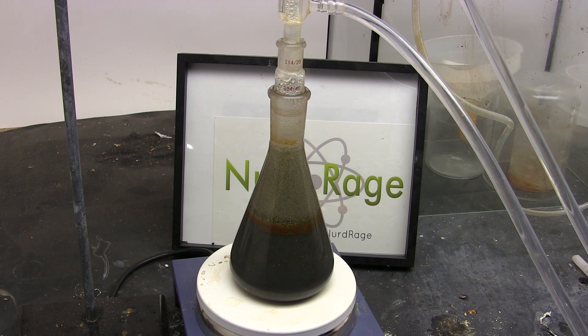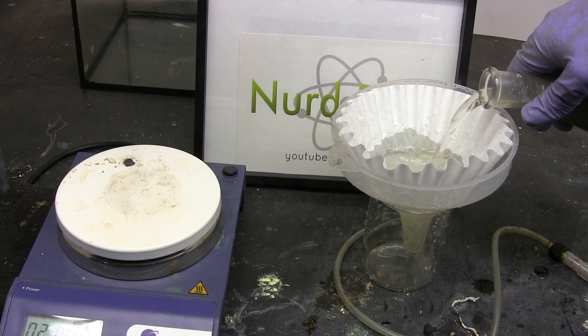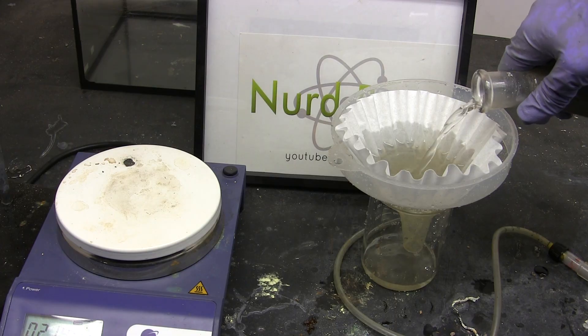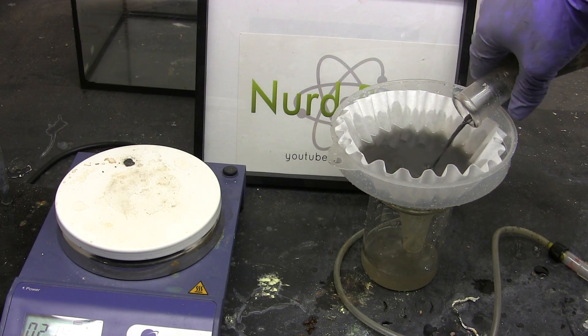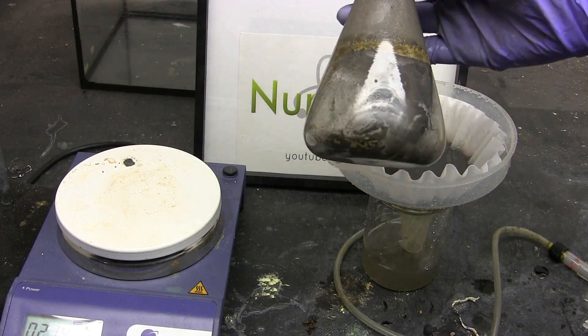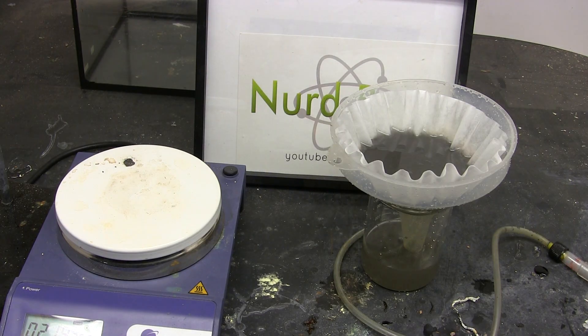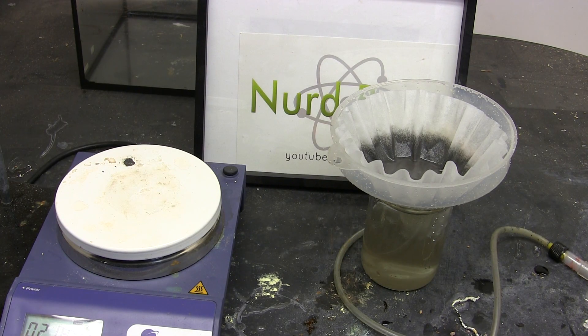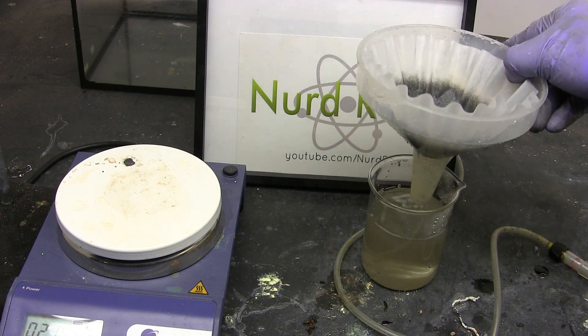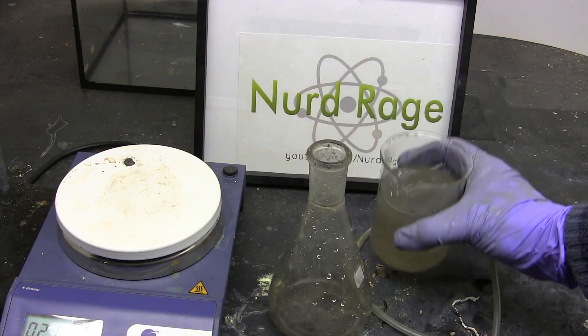Now turn off the heating and let it cool. Now we filter the mixture. As you can see it's much clearer with all the bromine reacted. The residue is black from bits of carbon that eroded off the electrodes. It should be yellowish from unreacted sulfur. Once everything is filtered transfer the filtrate to an Erlenmeyer flask.